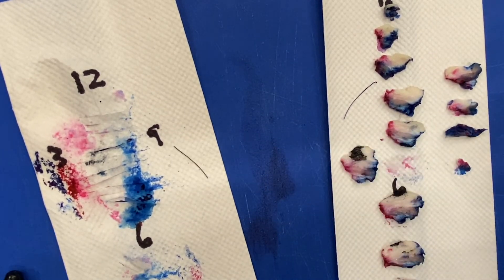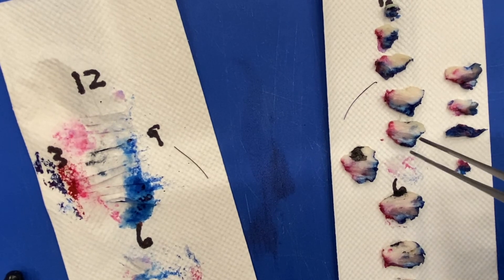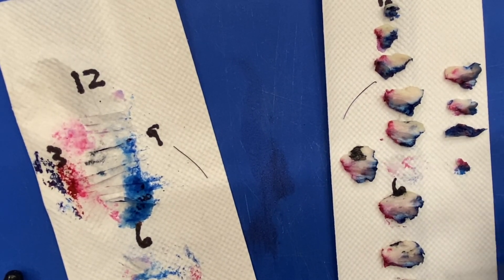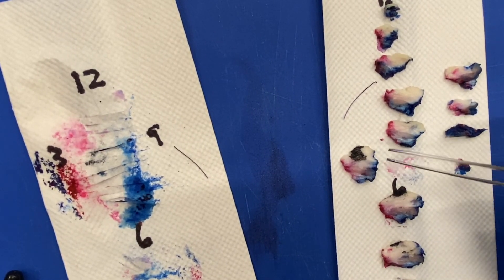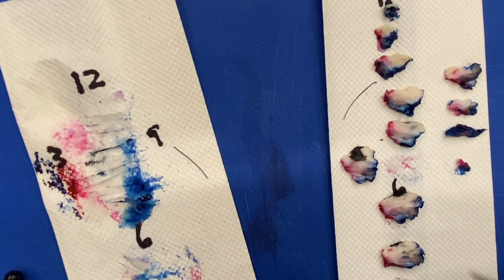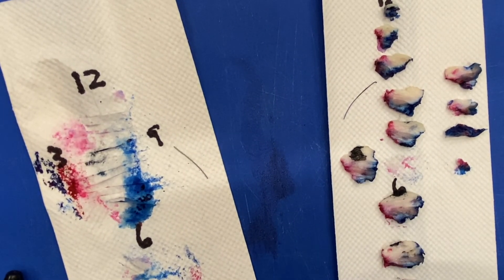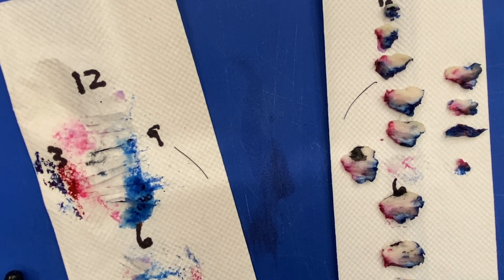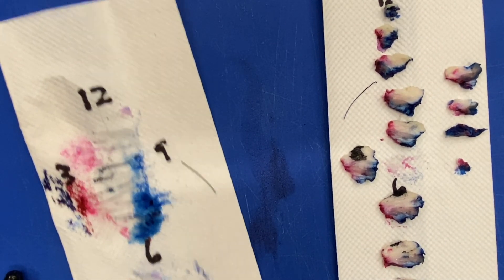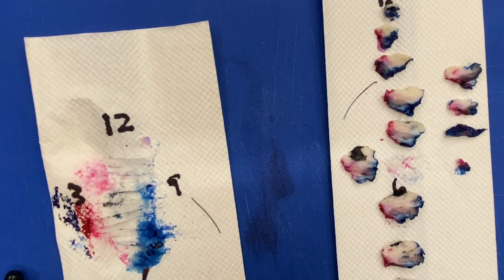Make sure that after you serially section your skin specimens, you measure and get that third dimension of your lesion — the distance of that lesion to the deep surface of the specimen. I hope that you've enjoyed this video. Please let me know if you have any questions.